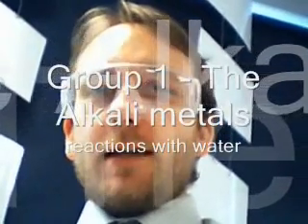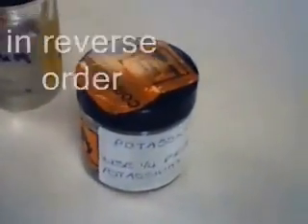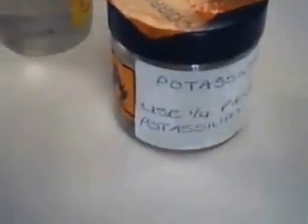I'm going to be telling you about alkaline metals and how they react. And in order to do that, I am going to show you my equipment. That's the water trough that I'm going to be using, I'm going to clip in the camera in a second. You can see there's the water in there. I'll give you a flyby of the alkaline metals. This jar has got potassium in it, and these two jars have got sodium in it, and that finally has got lithium in it.